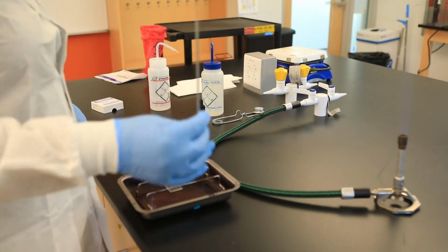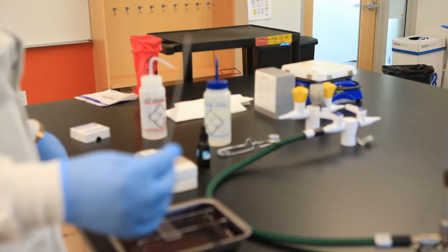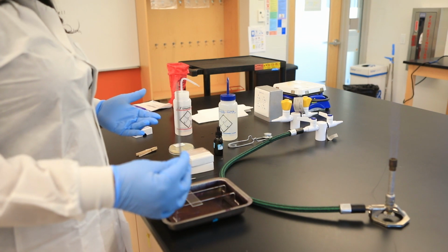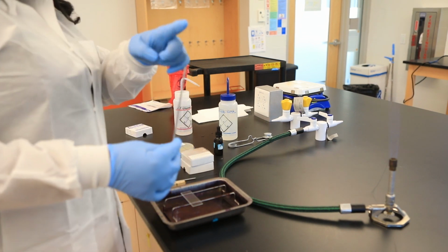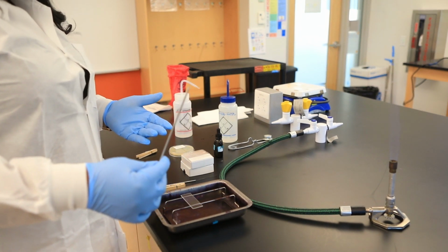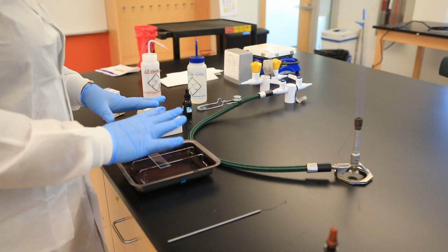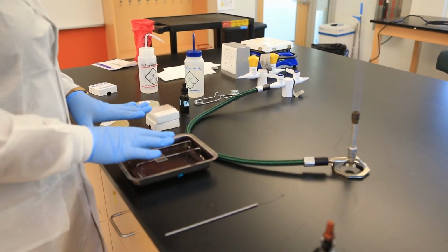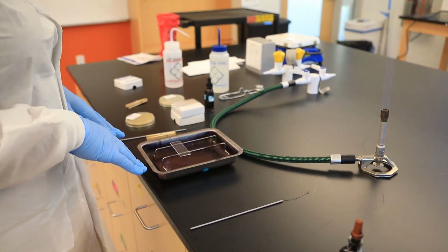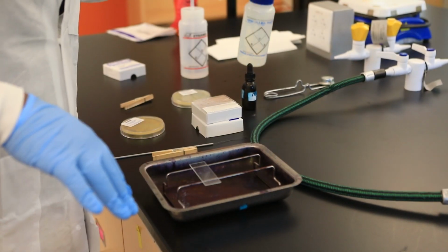We also need the inoculation loop. If you saw my aseptic video, I told you which inoculation tools you can use to transfer bacteria. Remember, it has the wire and this is the loop, but we have to sterilize it prior to transferring and after we transfer. We have our staining tray, which makes it easier to keep everything less messy and more organized. We have our glass slides here, a platform to place the slides. Here are our slides. And also we have distilled water.